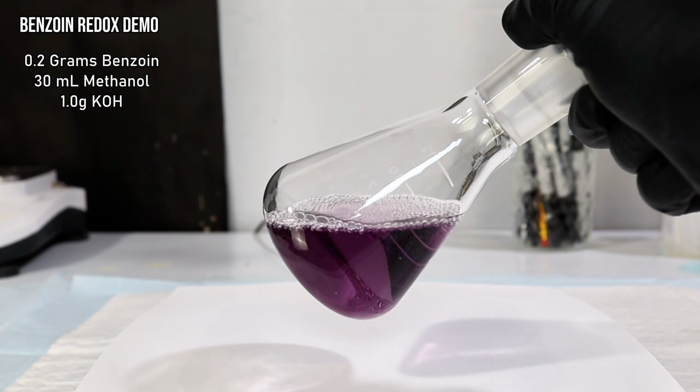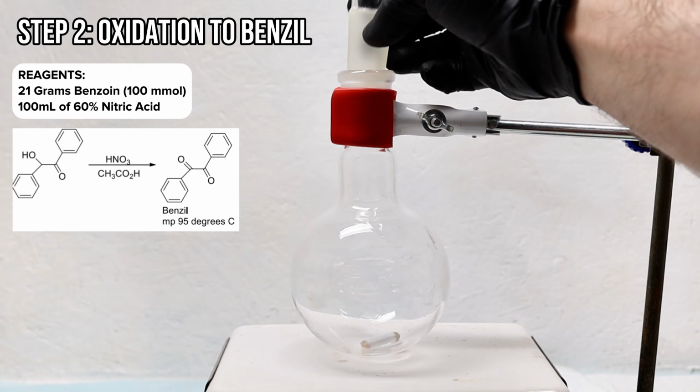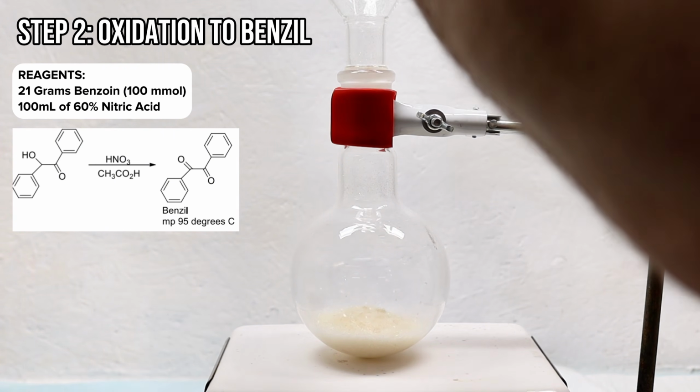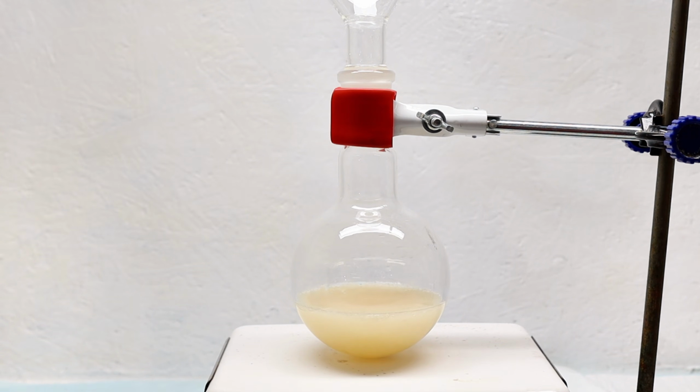Anyway, now that I finally had benzoin, I next needed to oxidize it to something called Benzil. Benzil is a bright yellow crystalline compound that itself is used in photochemistry and coordination chemistry, but for today, I'll only be using it to make my phenytoin. The procedure is pretty straightforward, and the easiest way to oxidize benzoin to Benzil is by using nitric acid. Nitric acid is ideal for this reaction because it's a very strong oxidizer, and in this case, it selectively oxidizes the hydroxyl without tearing the rest of the molecule apart, as long as you're careful.